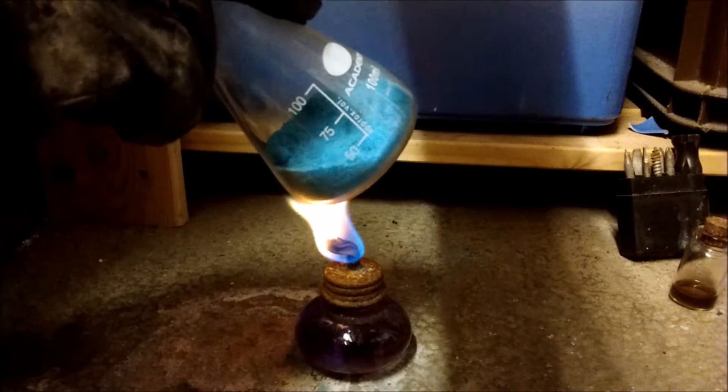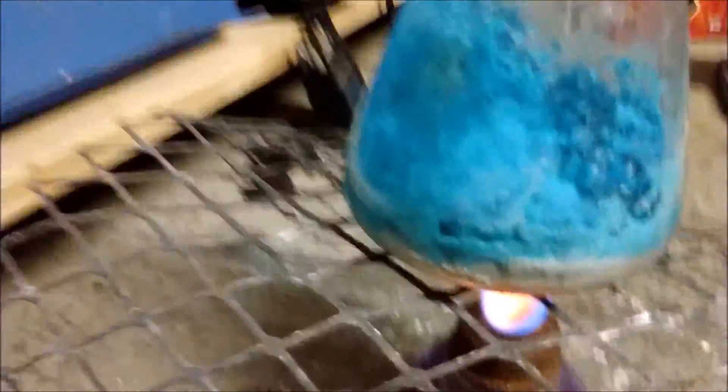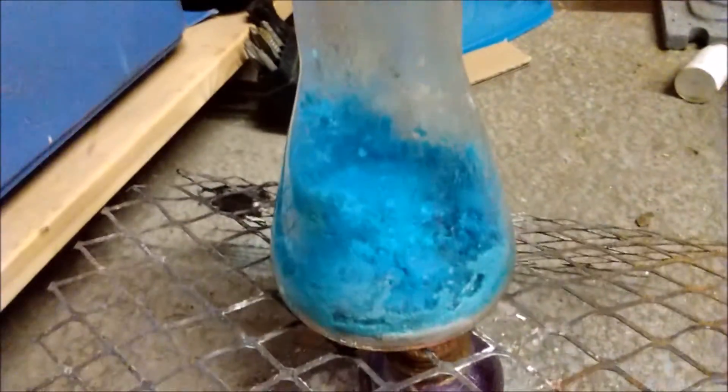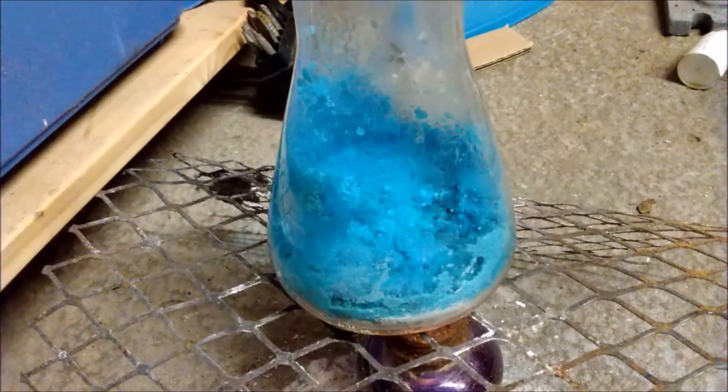At midway through the heating process, you can clearly see the steam coming off the top. And because as it's being heated and the water is coming off the below stuff, it's going into the top stuff. So, it takes a while just to boil off all the water in this.